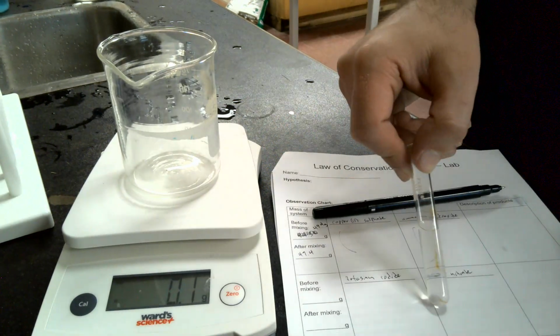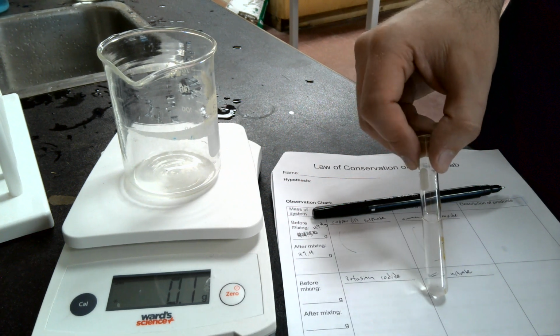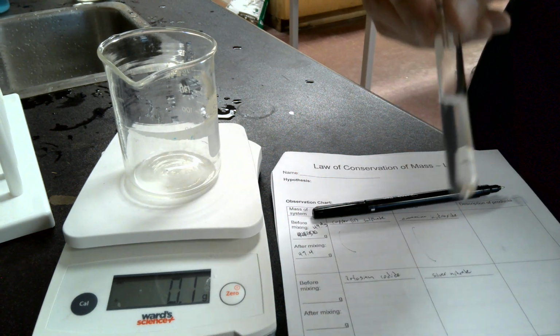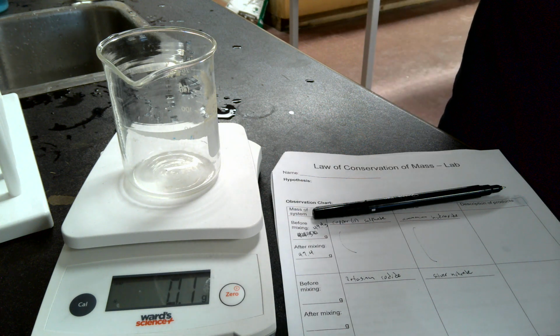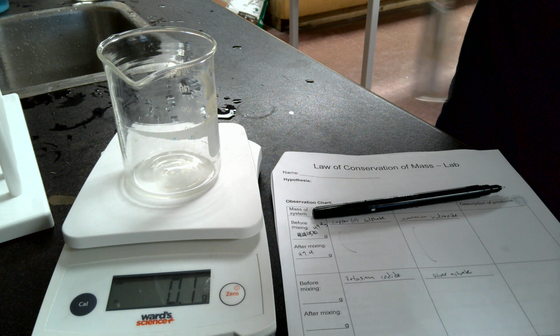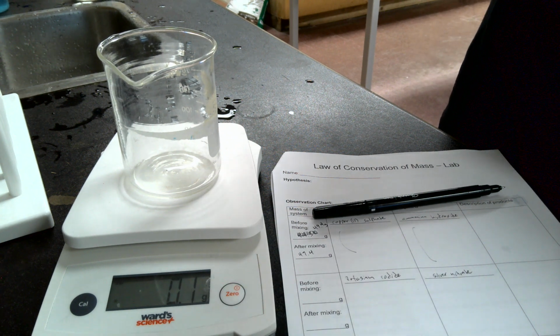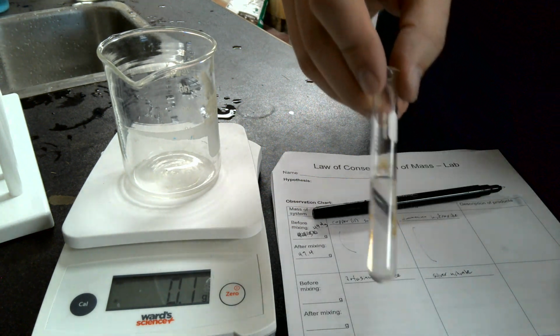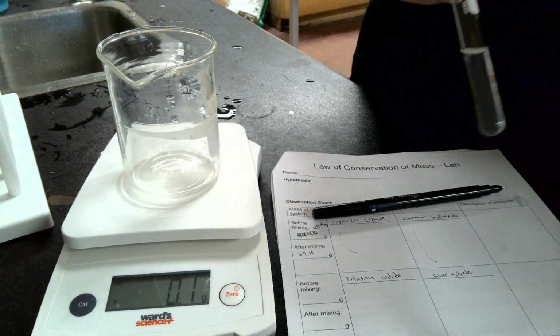You will notice, ignoring the stains on the test tube from some iodine, obviously, you can't really tell on the camera, but it does have just a little bit of grayness to the solution. So it's not perfectly clear, but that's mostly due to undissolved silver nitrate in there. When it's totally dissolved, it is clear, just like water for the most part.